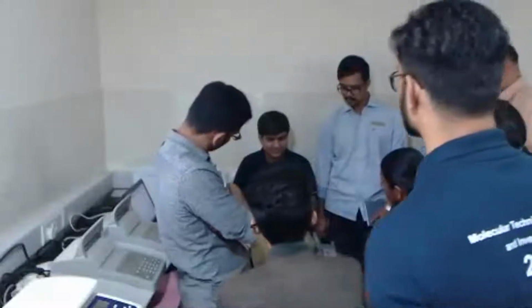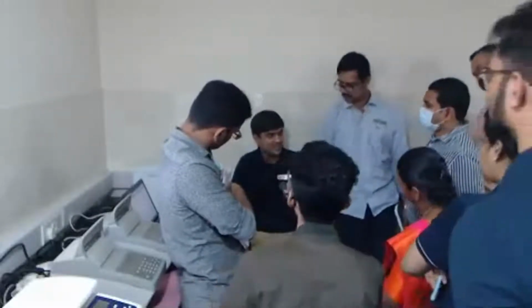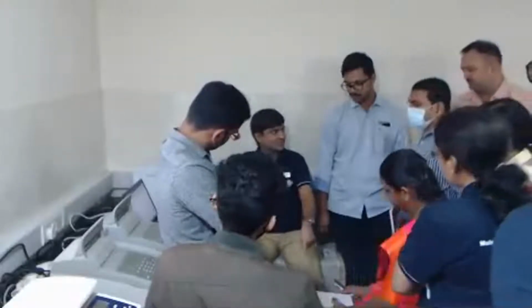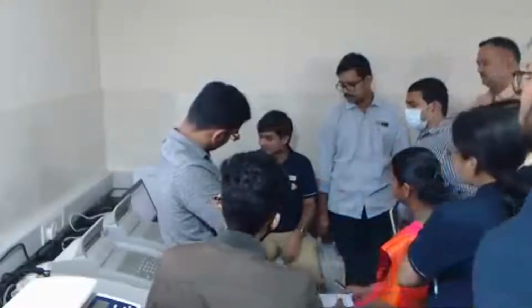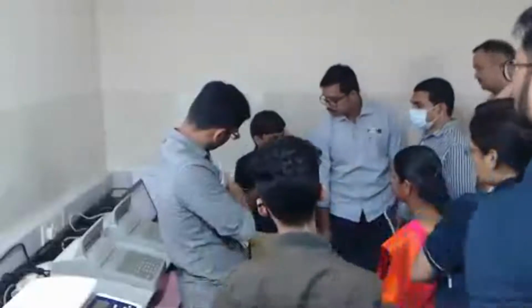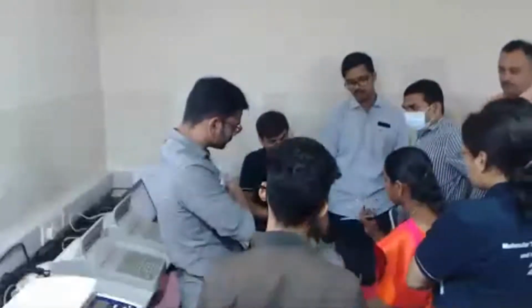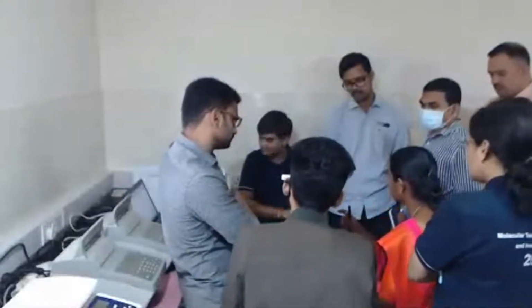In case of 16S metagenomics, you will be getting only a single peak, right? So whatever concentration you are seeing on Qubit belongs to that single peak only. Over here, whatever concentration you are seeing belongs to multiple peaks of different sizes. So that distribution is reflected, but not as exactly as in case of 16S metagenomics. So using the AMR panel, can we say that it is a particular class of AMR gene?